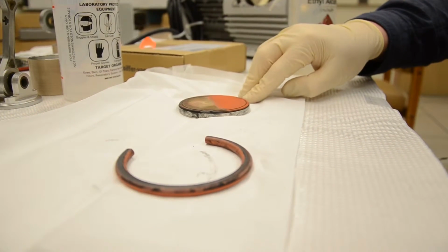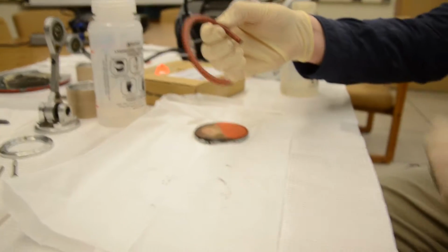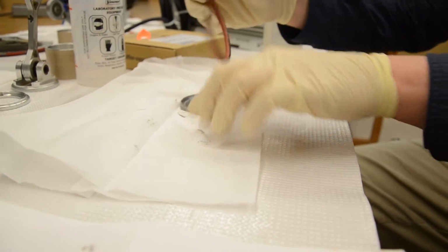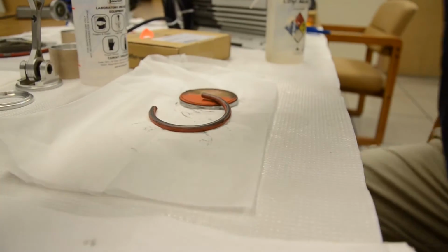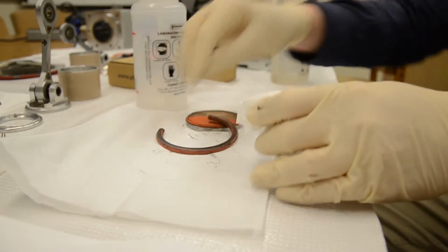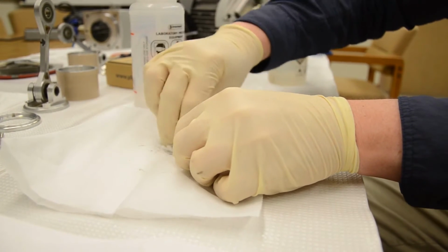The high pressure valve looks different. It's a Teflon piece, and we'll show that when we get to it. This does have another component, this rubber hose, and this rubber hose fits inside just like that. So we're going to have to clean this, and that's how we'll show you how to clean this. In this case, we are replacing both components, and we'll show that in a moment with the kit. But for now, I just want to show you the procedure for cleaning, and I bet you it's probably not going to clean up very well.